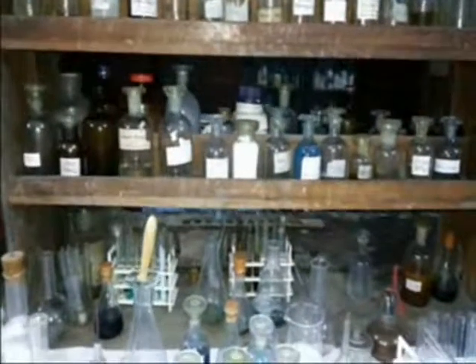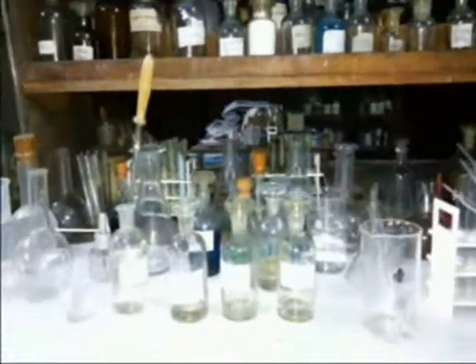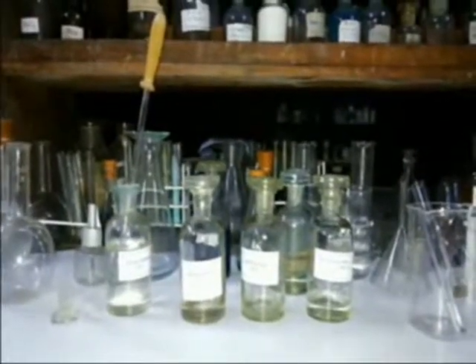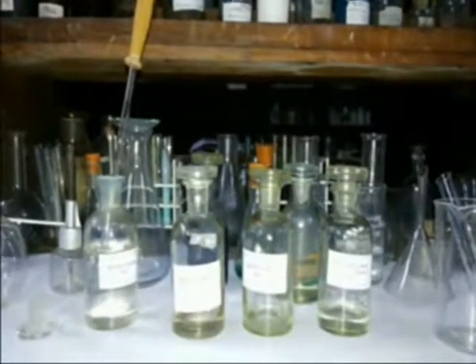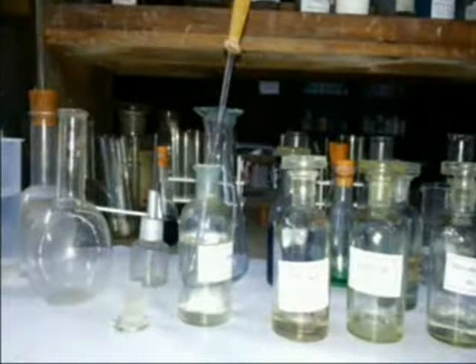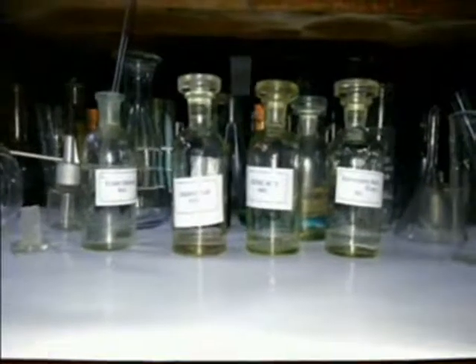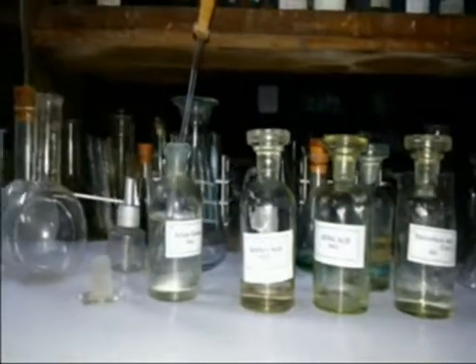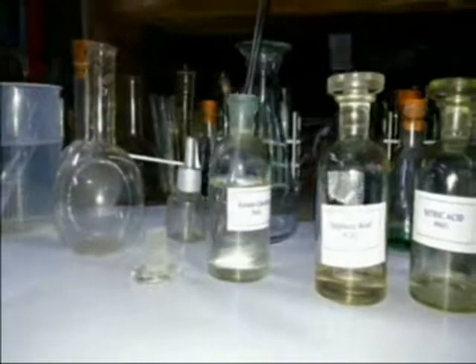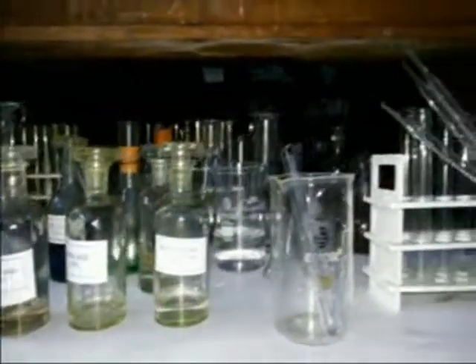Here I am displaying the experiments on the identification of sulfuric acid. Suppose you are supplied an aqueous solution and you need to identify whether it is sulfuric acid or not. In aqueous solution, sulfuric acid dissociates into H⁺ ions and sulfate ions. Detection of the sulfate ion indicates the given solution is sulfuric acid. This can be done by adding aqueous barium chloride to the examined solution. Appearance of a white precipitate indicates the presence of sulfate ion, meaning sulfuric acid.